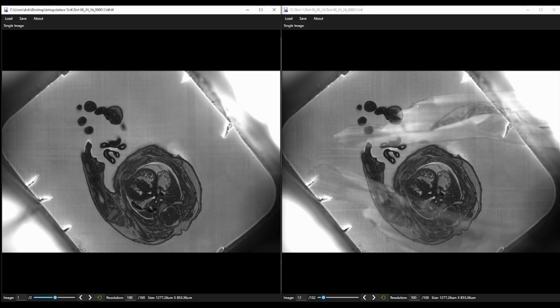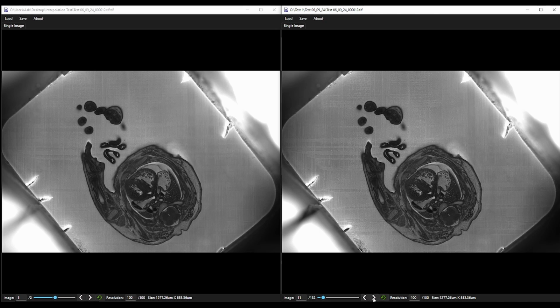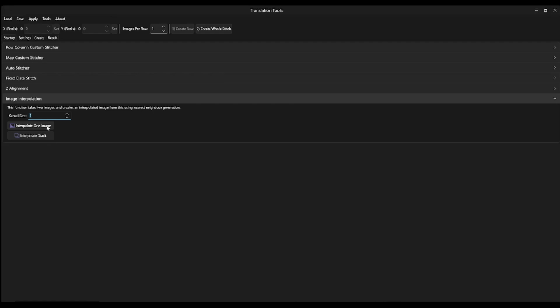So what we can do is look at the data set, and on the left of the image we have a really nice section, and we also have another really nice section to the right of the image. And what we're able to do is compute this mathematically into the interpolated image. So what I'm going to do now is go into the translation tool software. What I'm going to do is click Interpolate One Image.